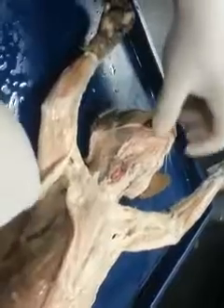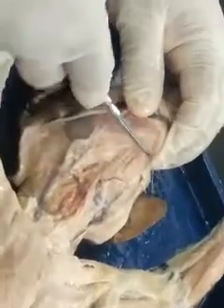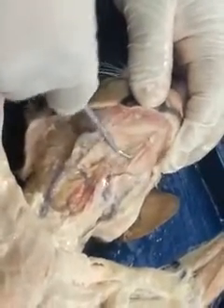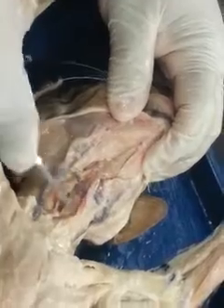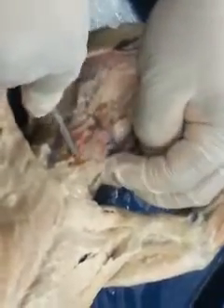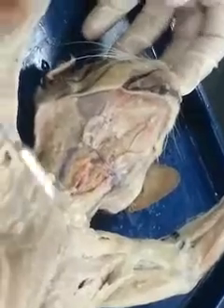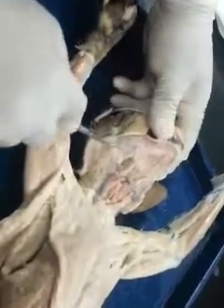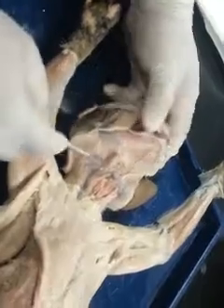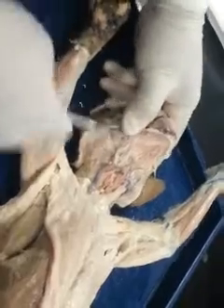Now for the muscles of the neck, since they're right here, you have your digastric muscles, which are going to allow you to open the mouth. The mylohyoid, which is going to function as the floor of the mouth. The sternohyoids, these two band-like muscles. The sternomastoids, which in humans this will translate to the sternocleidomastoid. Right. In this case, bilateral contraction allows you to flex the neck. Unilateral contraction allows you to rotate the head. The last large muscle here is the masseter muscle, which is going to allow you to close the mouth during chewing, along with the temporalis, which is not visible here.